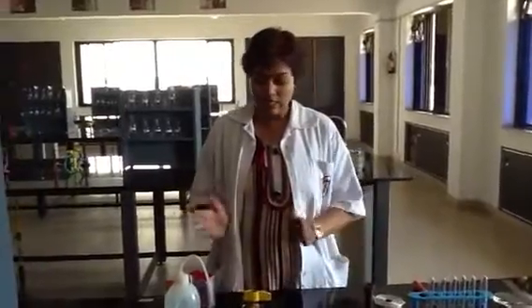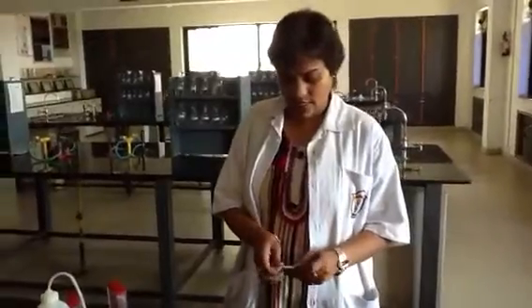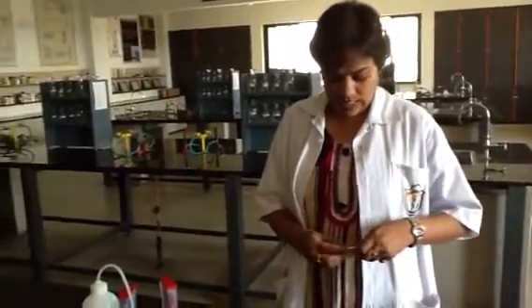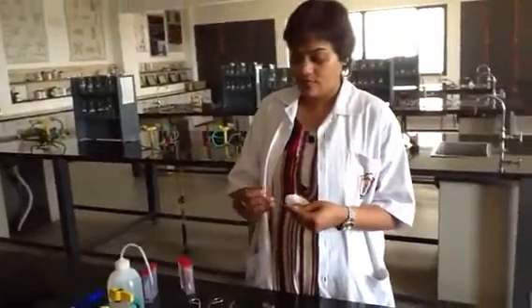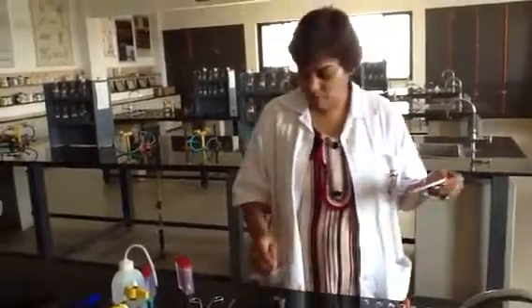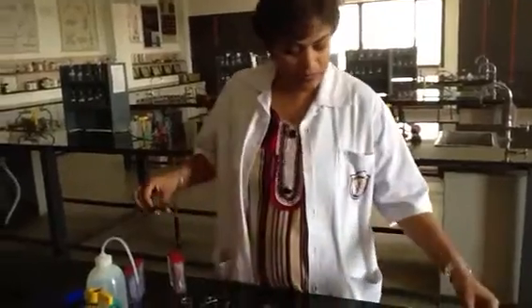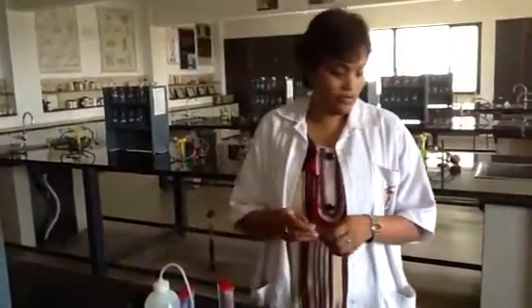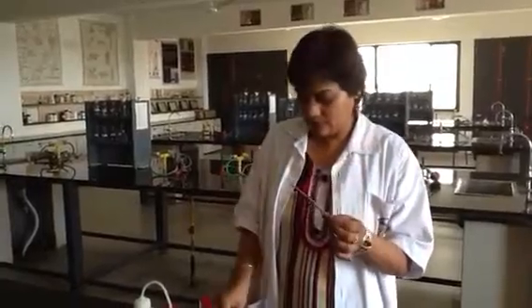So today we'll learn something after seeing the demo of some of the reactions. Here I am performing a few experiments which you have to observe carefully, because I am going to ask you a few questions after this, or you will be having some worksheet also on the basis of that, which will be uploaded on our blog. This is magnesium ribbon, which is silvery white in color.